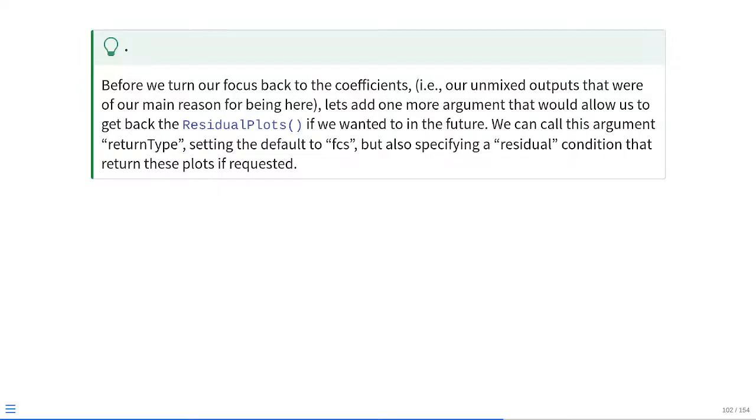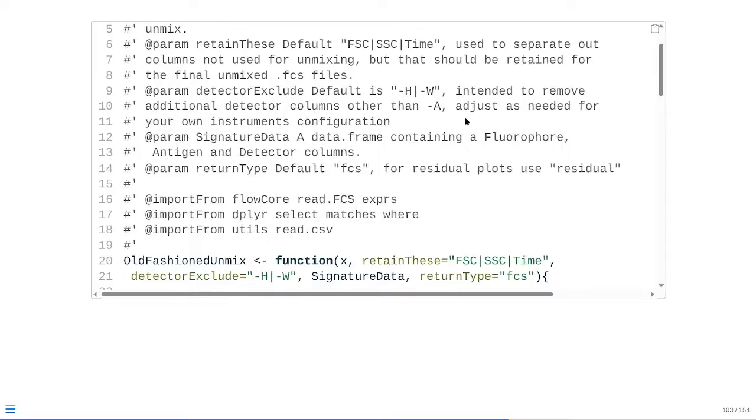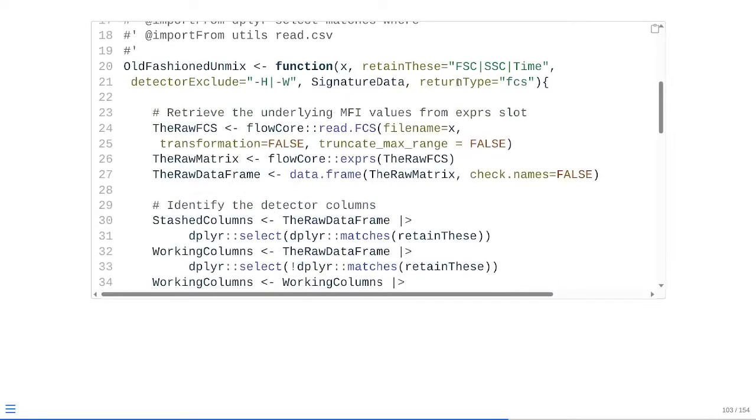So, before we turn back to coefficients, i.e. those unmixed outputs that were our main reason for being here, let's add one more argument that would allow us to get back to residual plots if we wanted to use them in the future. We can call this argument return type, setting the default to FCS, but also remembering to include a residual option to return these plots to us if we so wanted to see them and visualize them later on in the future. So, once again, new argument, new update into the Roxygen 2 skeleton, and we place it as well as its default present within old-fashioned unmix.